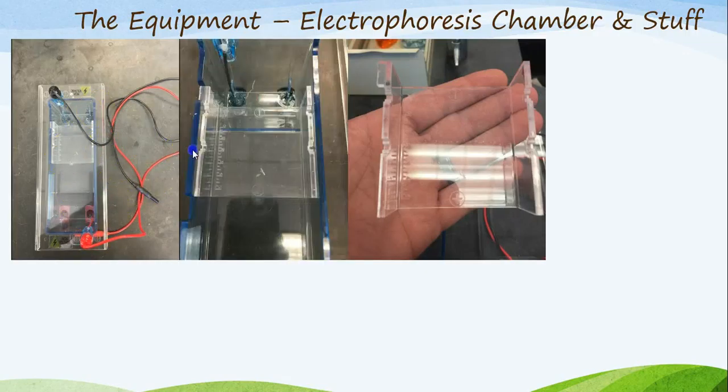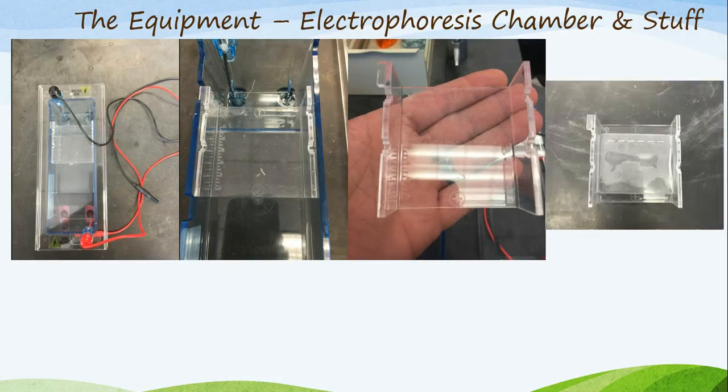Once you remove that lid, you will notice that there is an empty chamber inside of here. Inside of this chamber, we are going to fill that with TAE buffer solution. About 400 mils of buffer solution are going to go into this entire thing. The main goal is to fill it until it totally covers what we call the gel electrophoresis tray. This, my friends, right here is the gel electrophoresis tray. This gel electrophoresis tray holds, believe it or not, the gel.